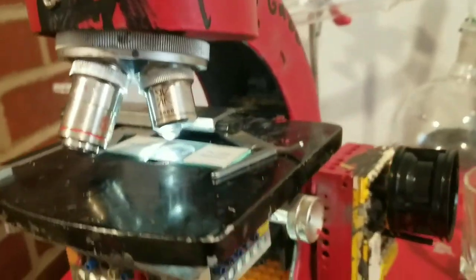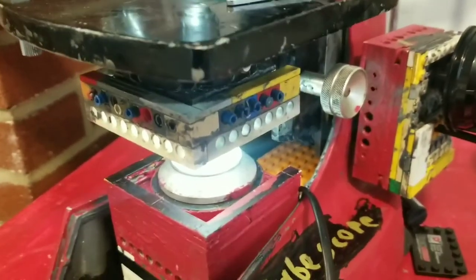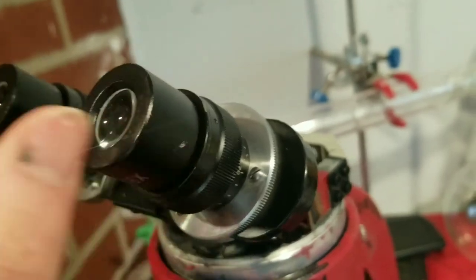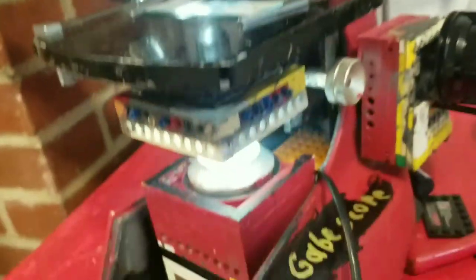temporarily. When movie theaters open back up, I'm going to get polarization filters from 3D glasses, which I can cut down and JB weld onto the tips of these. But for now, I'm just going to have this polarizer.